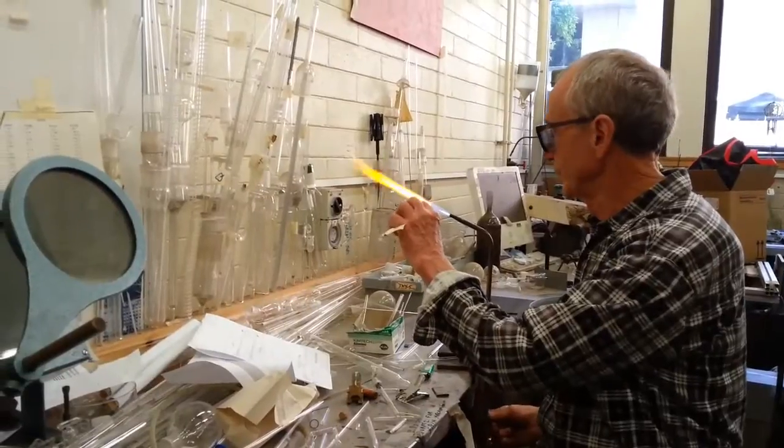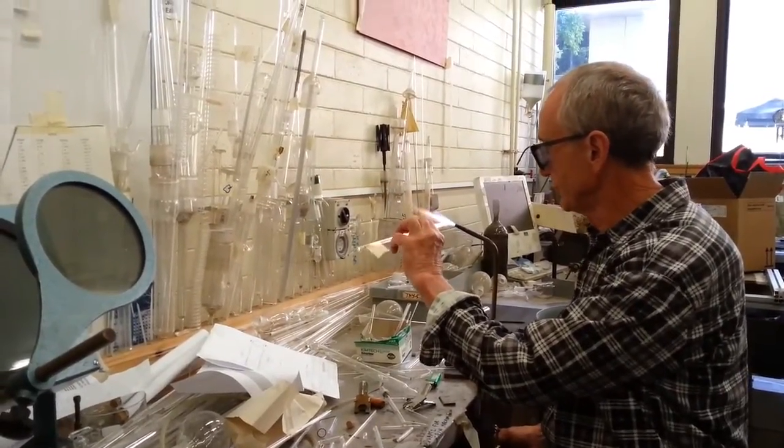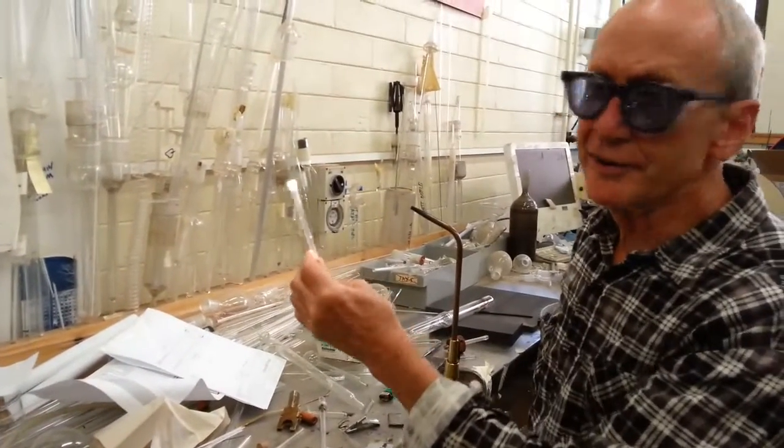I can also, apart from working with glass, this is a piece of quartz. It's 2,000 degrees there.